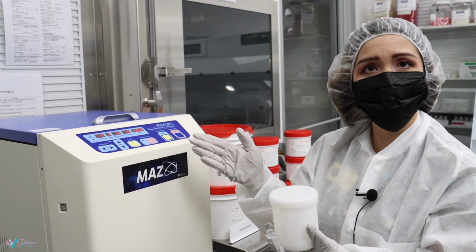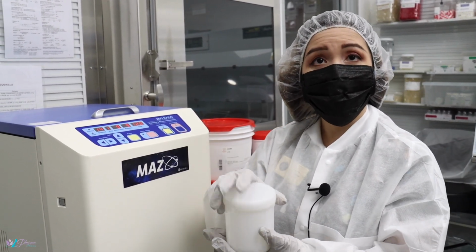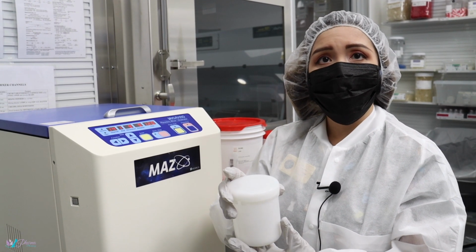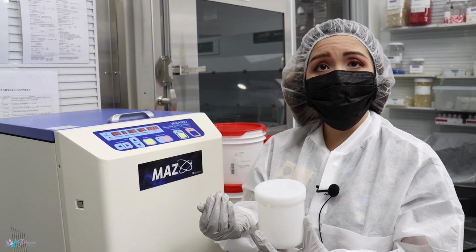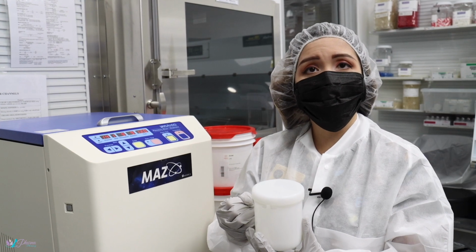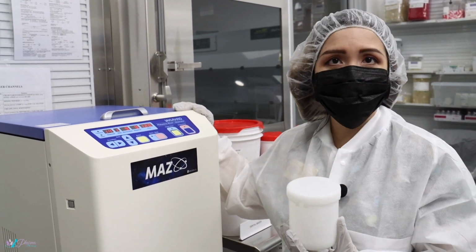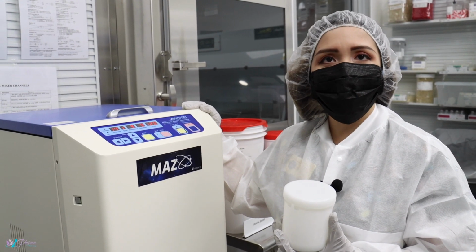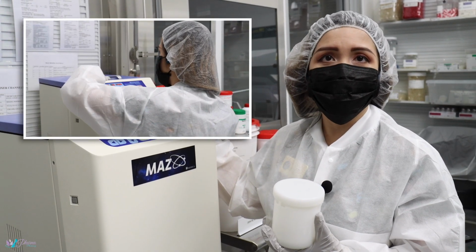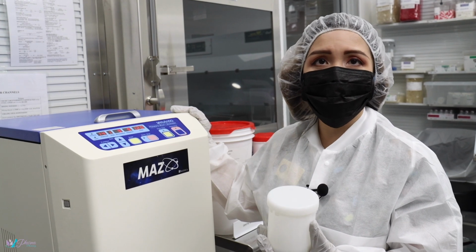In addition to spinning this way, the mixer also de-aerates the mixture, which means it removes the oxygen, the air, from the mixture. This is very good for our compound because it ensures that oxygen does not remain inside and potentially degrade the compound over time. We call the mixer our half technician in the lab. It replaces half of the technician, saves us a lot of time, and ensures that the patient gets a great final product.